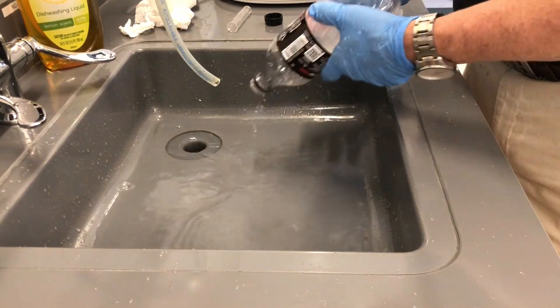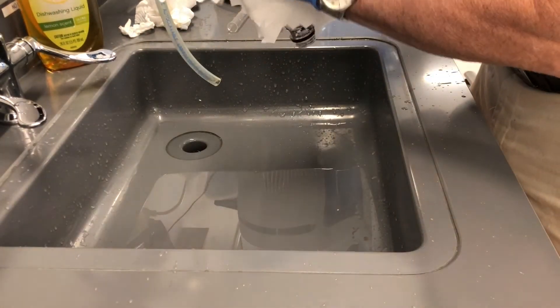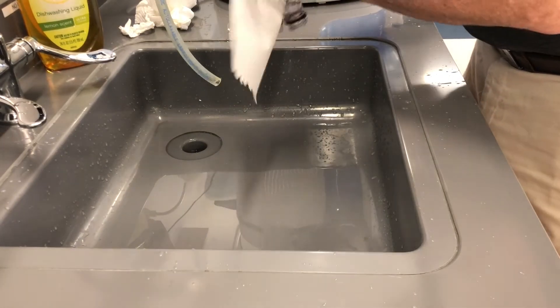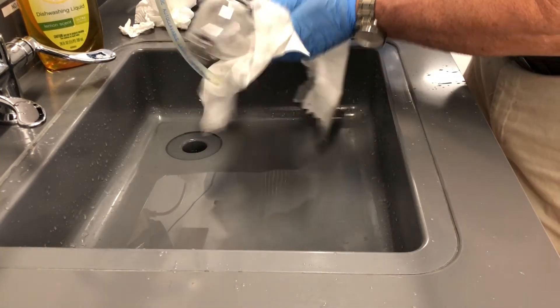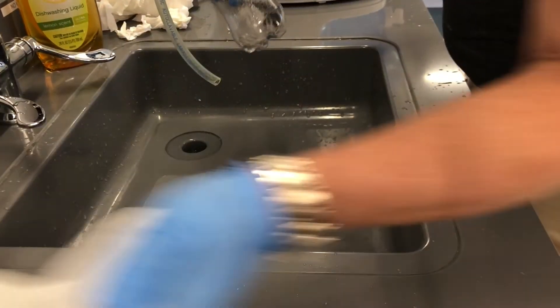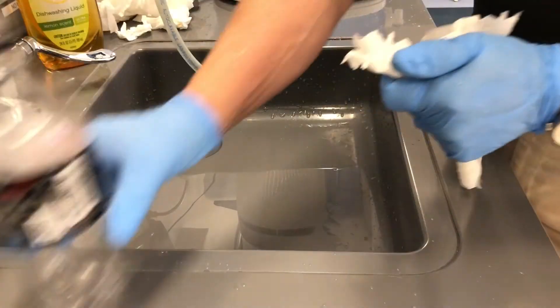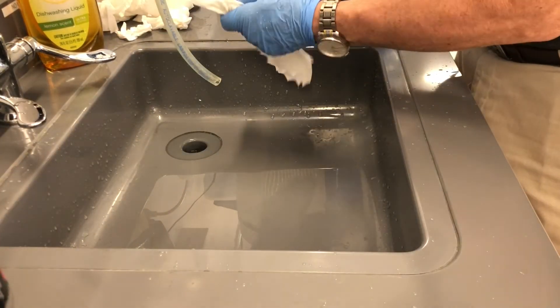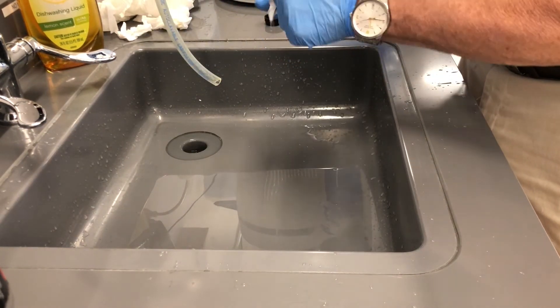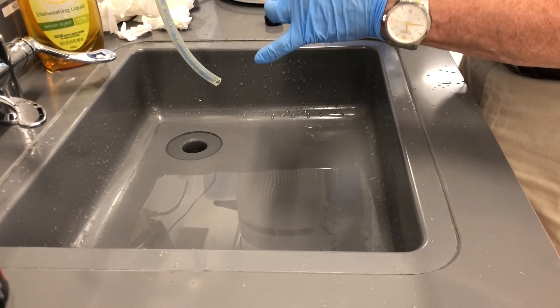What you're supposed to do at this point is do your absolute best to get everything dry. My gloves are wet, the tube is wet, everything is wet, so we're going to try our best to get everything dry. We will have to throw away all the paper towels. Try to get it really dry. I'm going to dry the tube — it's the outside that matters, not the inside. You want to make sure the outside of the containers are dry; the inside doesn't really matter for the most part.